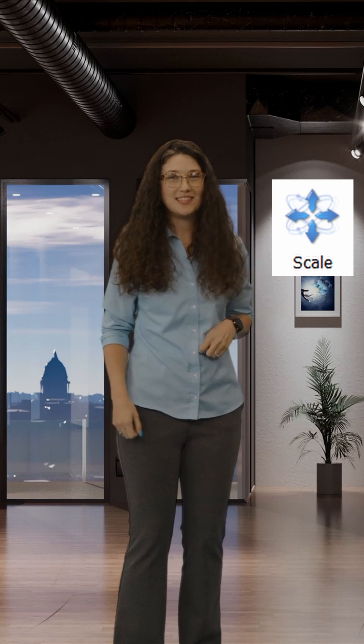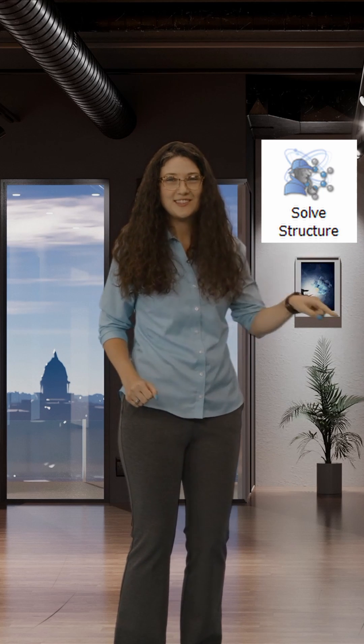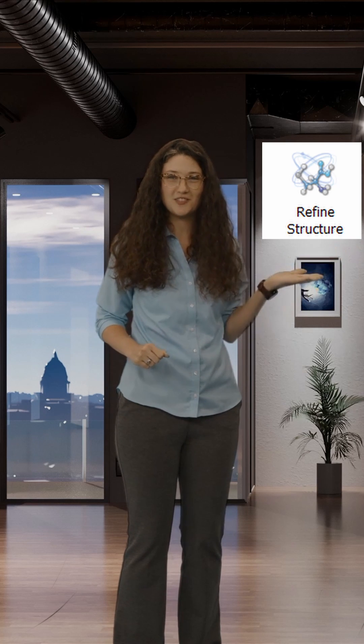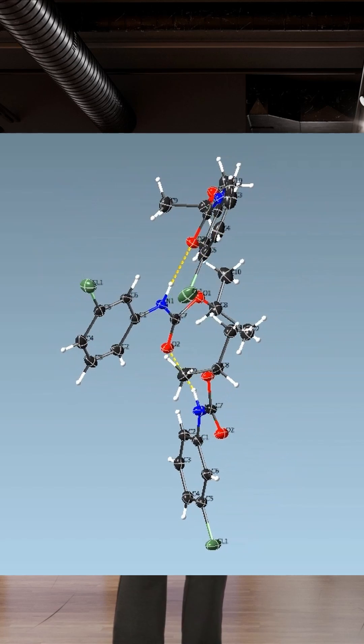Now that we have our unit cell, we're going to go straight into integration, and we will integrate and scale this one scan. Now, go to Solve Structure and click Solve. This is a model of your structure. If you want to improve upon this model, you can go to Refine Structure here, and this is what mine looks like.